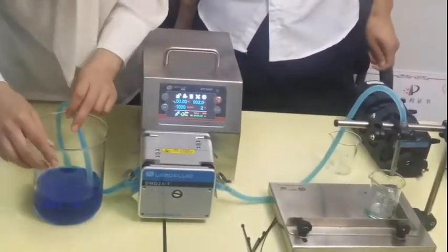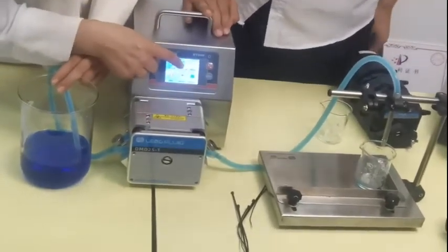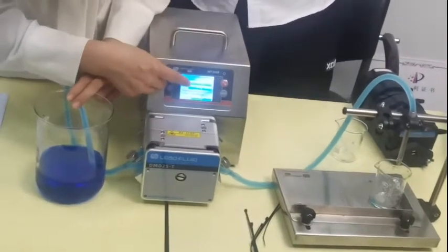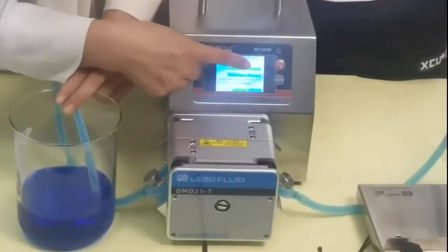Okay, let me calibrate. Let's go to the gear key, and there is calibrate — press in. Speed is 1000 milliliters per minute.